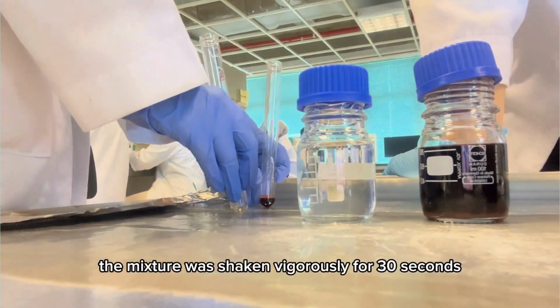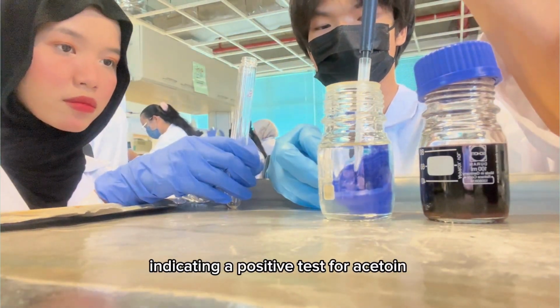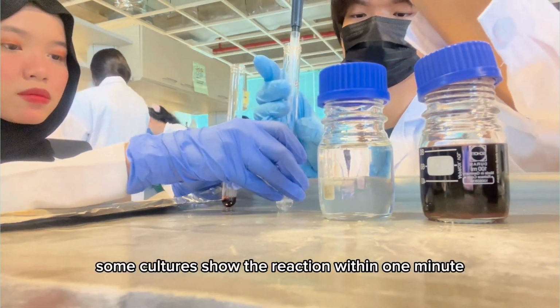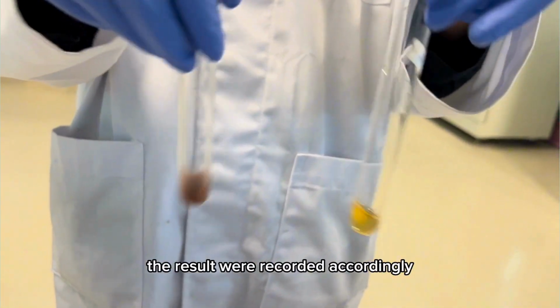The mixture was shaken vigorously for 30 seconds and the tubes were observed for the gradual formation of a pink to red color indicating a positive test for acetoin. Some cultures showed the reaction within 1 minute while others took 1 to 2 hours. The results were recorded accordingly.